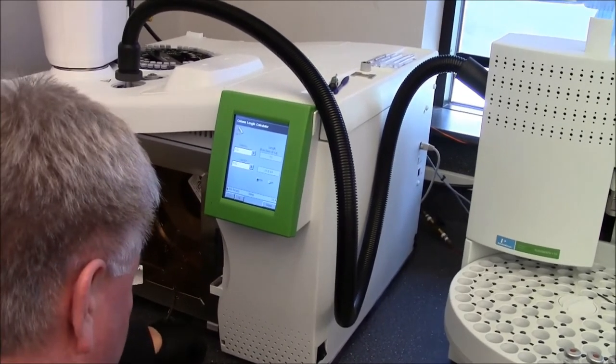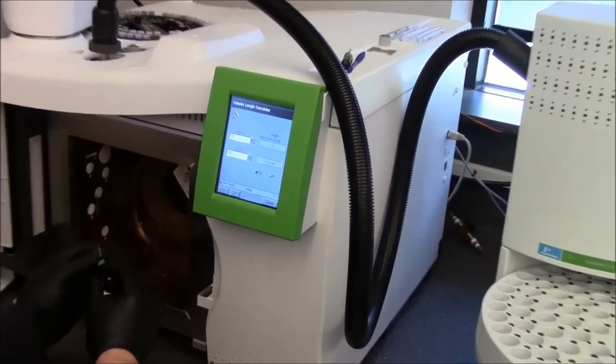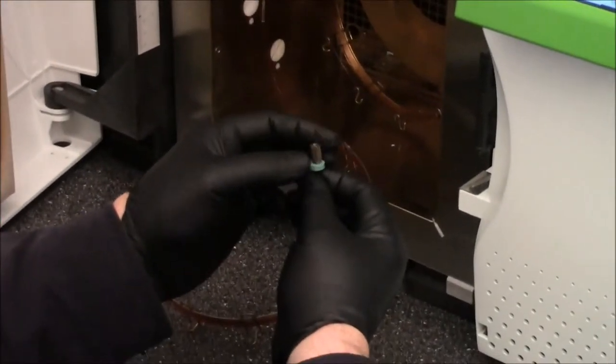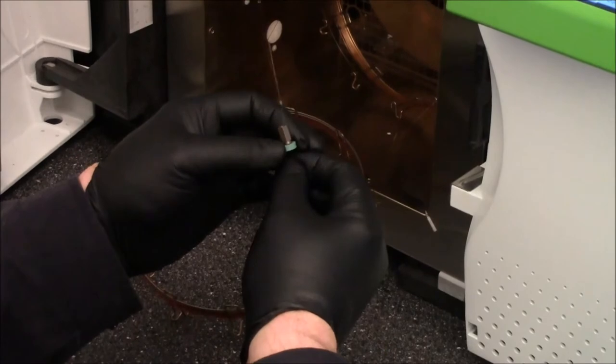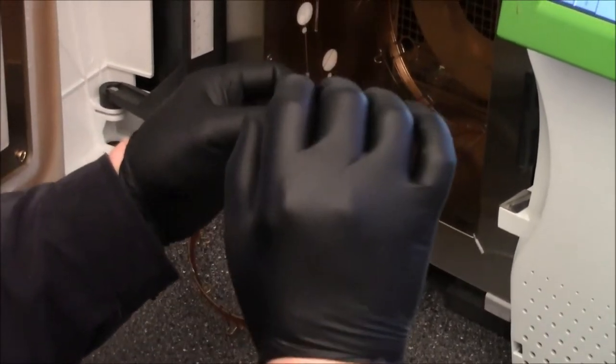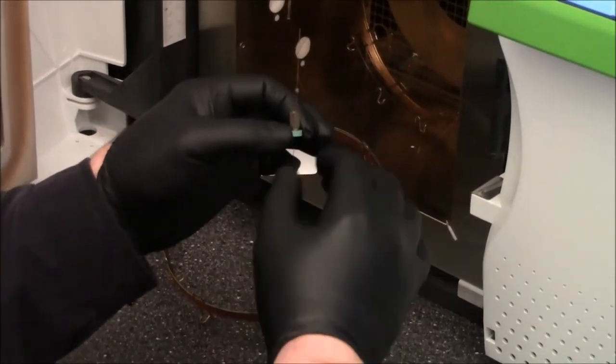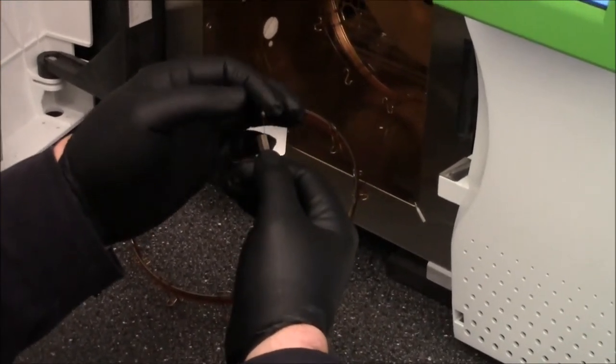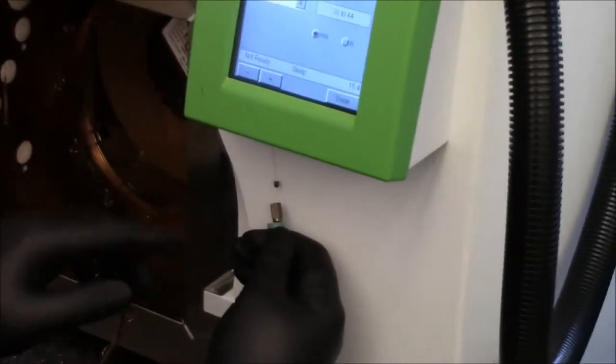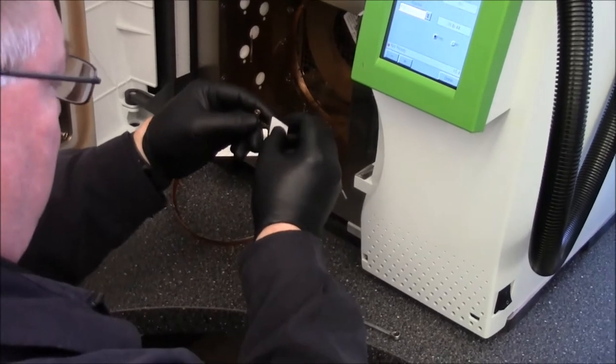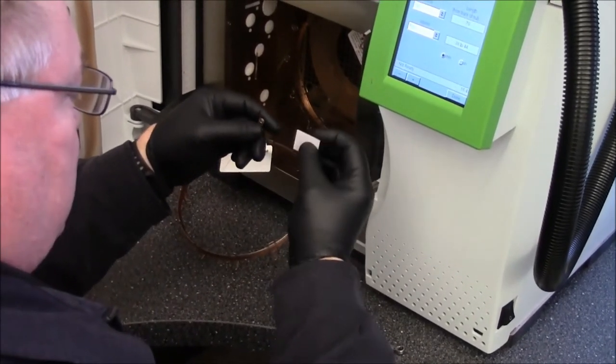When you get your column, you cut off a little bit of the front, then you feed through first of all this little septum because it's going to kind of help hold everything in place as you put it up there so it's not changing its length. And then you have your nut and then you have your ferrule. And on our ferrules, it's a little hard to see without a proper background, but ours, unlike Agilent, Agilent's tapers up into the injection port, ours tapers into the nut.